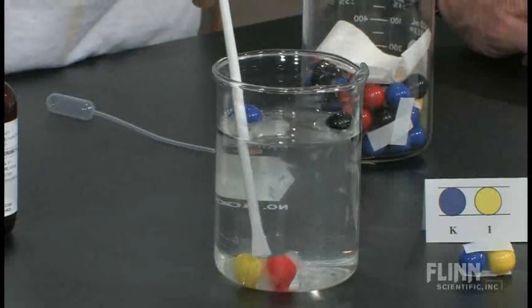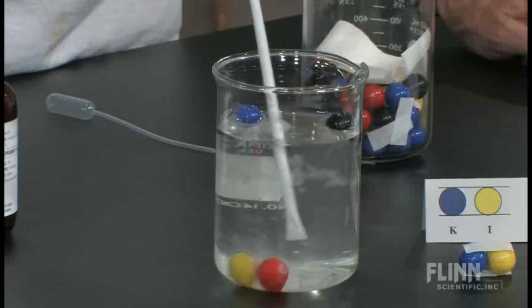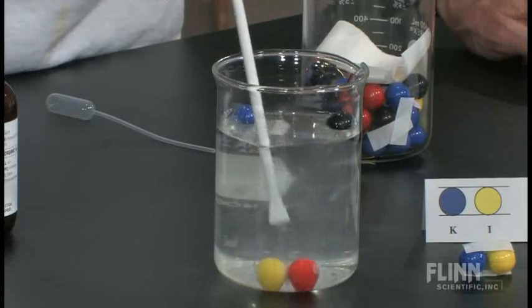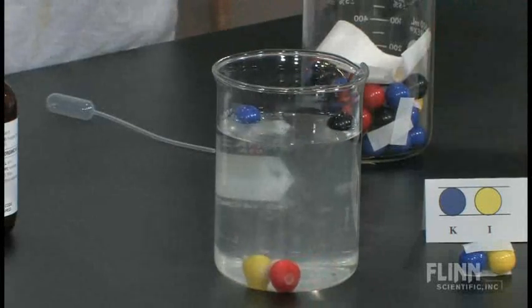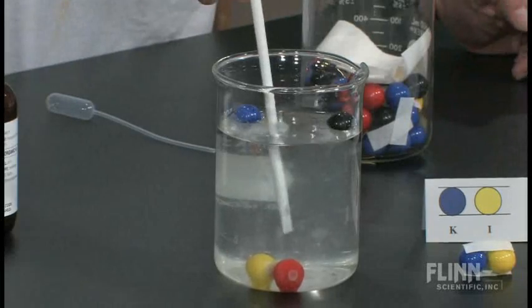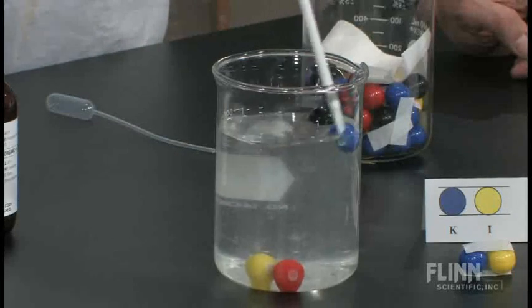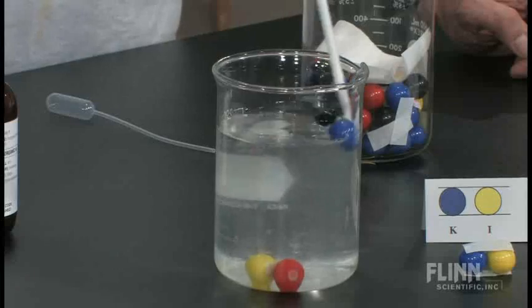Amazing. This is my precipitate. See that? It's stuck together. They've glommed onto each other. Silver iodide laying on the bottom. And these are the two ions, they're going to be in solution.